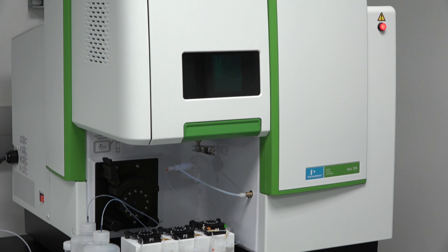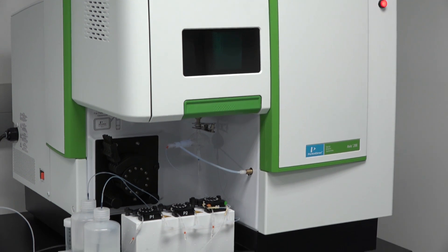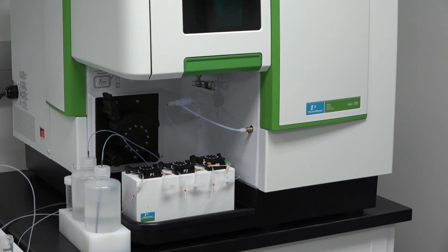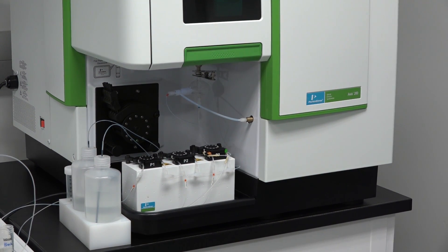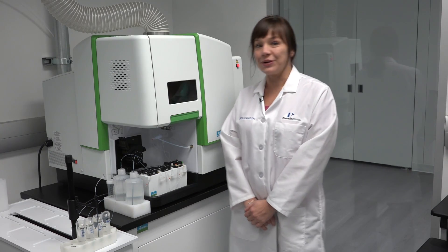The PrEP3 will automatically build your calibration from a stock standard or stock standards. It will automatically dilute the sample if it is over range, and it will automatically dilute the sample if the internal standard recoveries are out of range. This all results in less human errors, less possible contamination, and most importantly, time savings for you. So let me show you how this works.